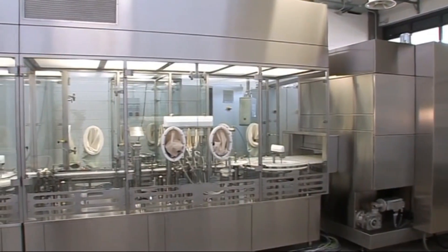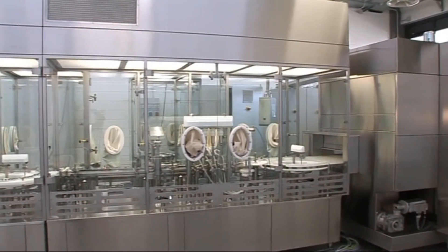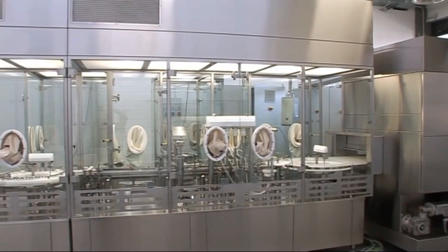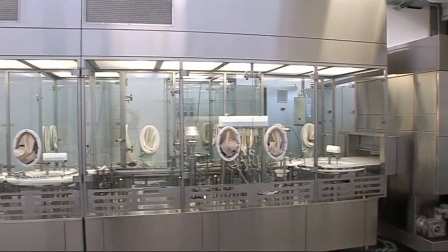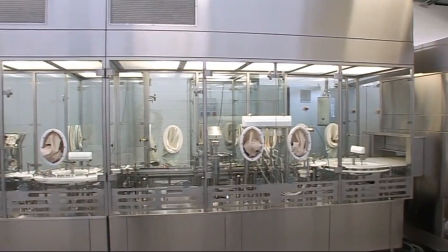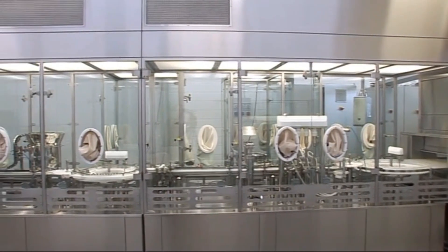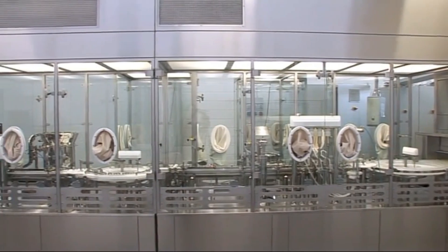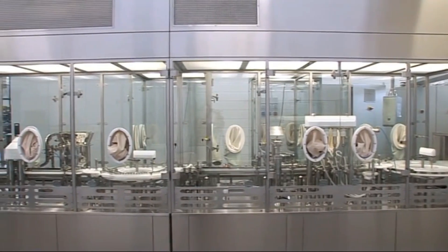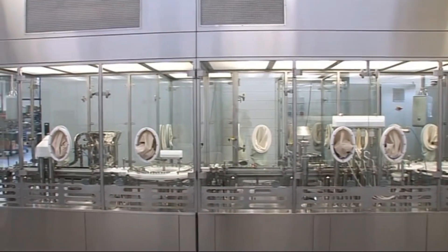Restricted Access Barrier Systems, RABS — Design and structure. RABS is a semi-closed barrier system with glove ports, where operators can interact with the environment inside the RABS, but the system can be opened in case of interventions.